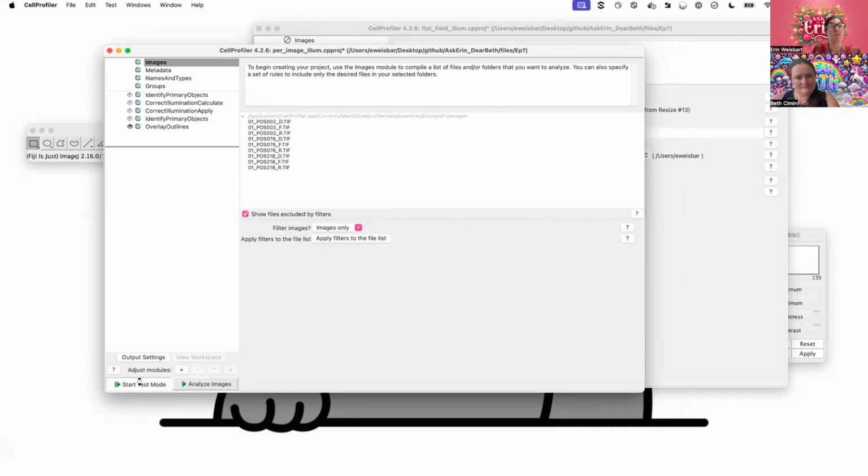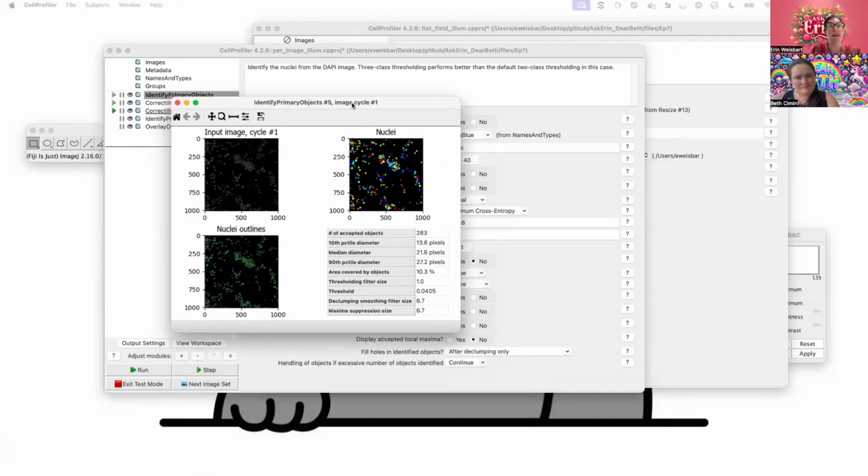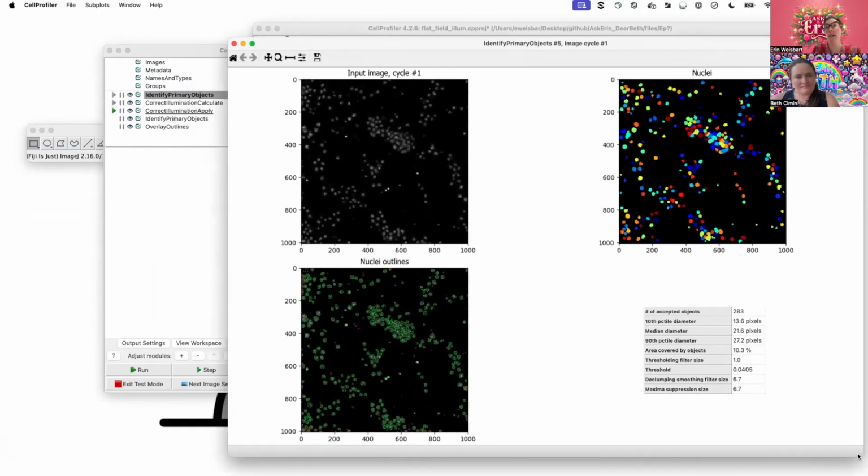this tiny little example. And so what we have here is I am identifying primary objects, and this has had certainly some tuning. This is the settings that come again with our default pipeline.